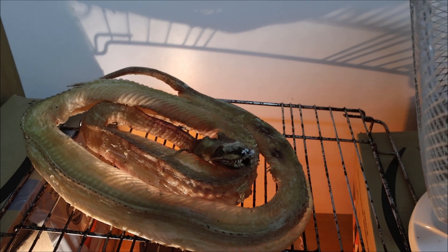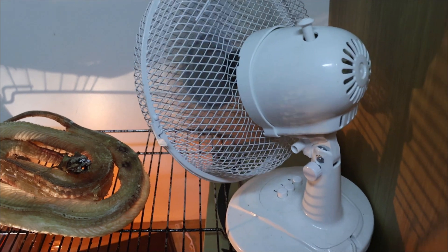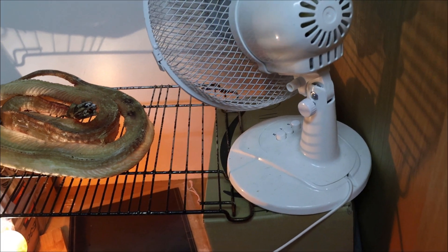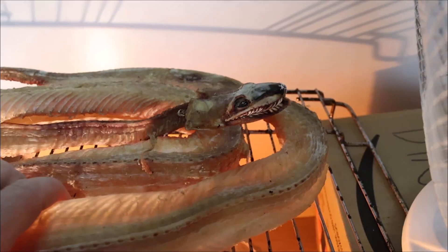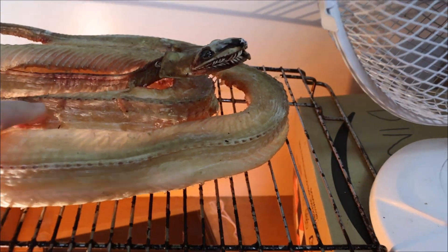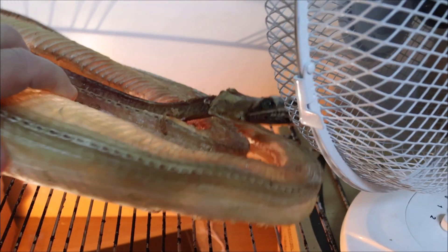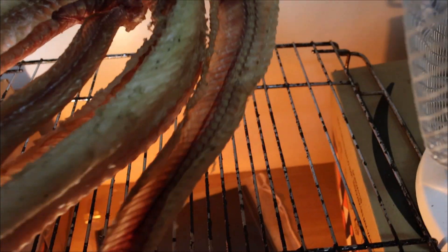Really small things like mice and very small birds can just be popped on a heat mat and they'll be done in a few hours. The time it takes to dry out will depend on the size of the specimen, how much flesh you leave on it, its shape, and the way you manage the temperature and airflow. A week or so should see you right on something of this size. You'll know it's done because the specimen becomes rock hard. Once it's fully dried it will last for years without further treatment as long as you keep it dry.